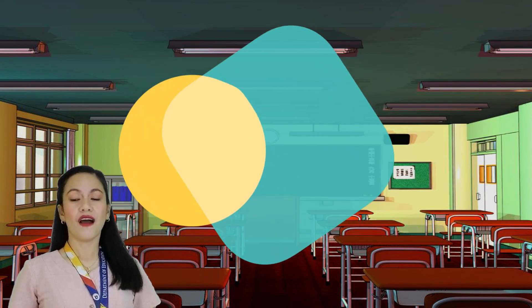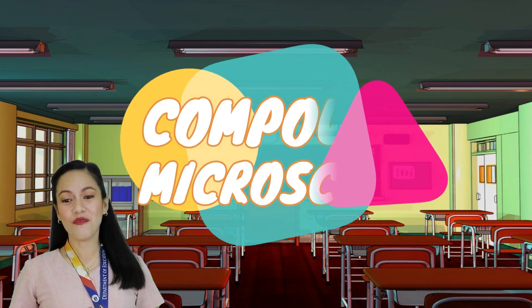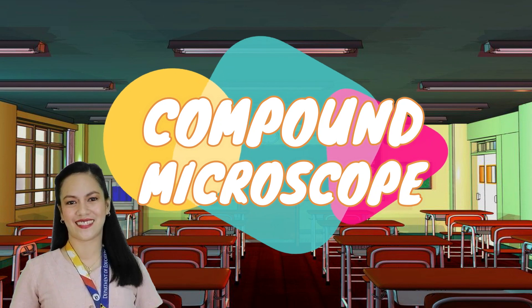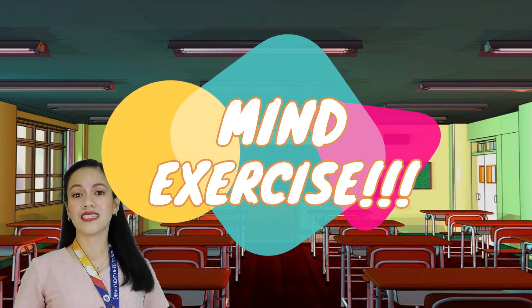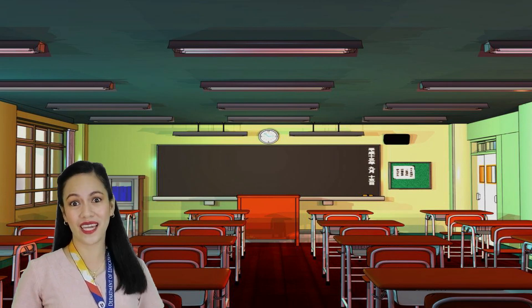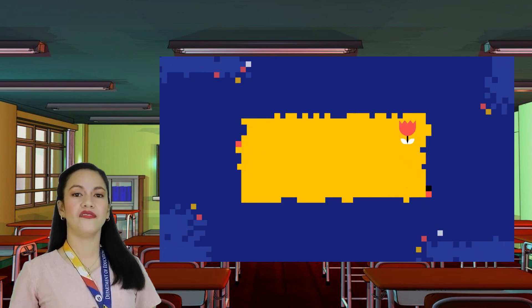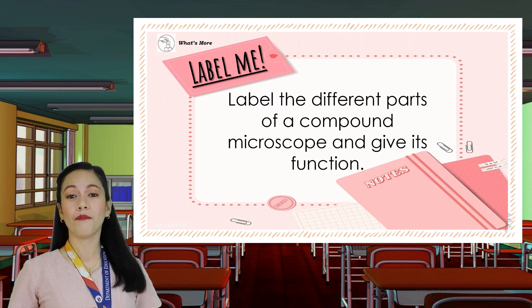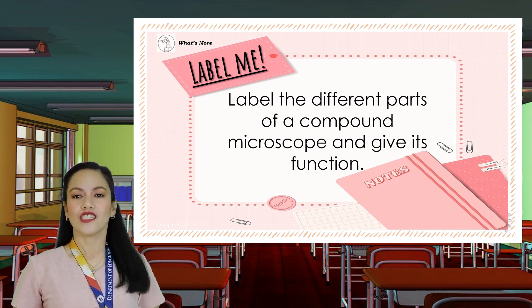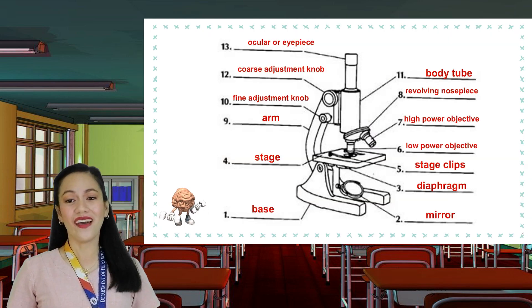And that's all for the parts and functions of the compound microscope. What great information we had today, students! To check if you've understood our lesson, let's have a mind exercise. On your module under 'What's More,' Activity 2, page 8, let's label the different parts of the compound microscope. I'll give you a minute to do the activity. Well done, students!